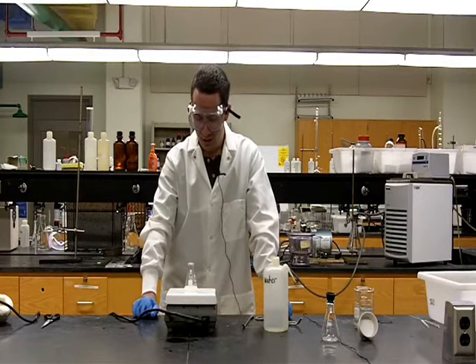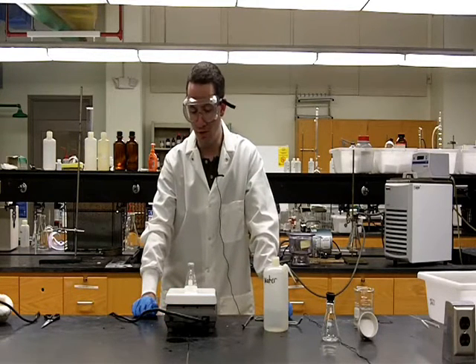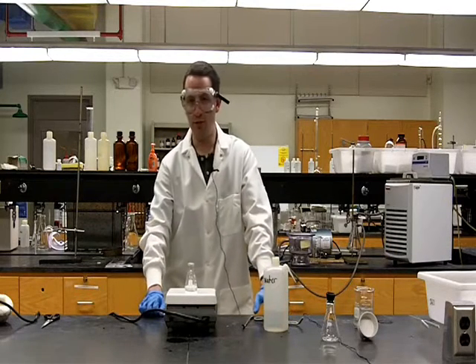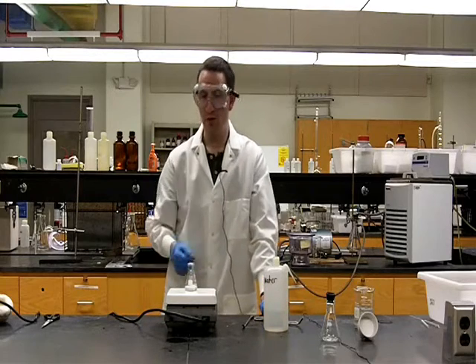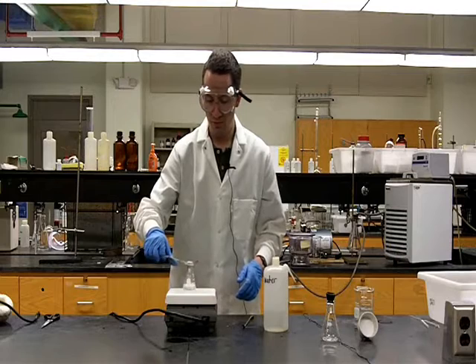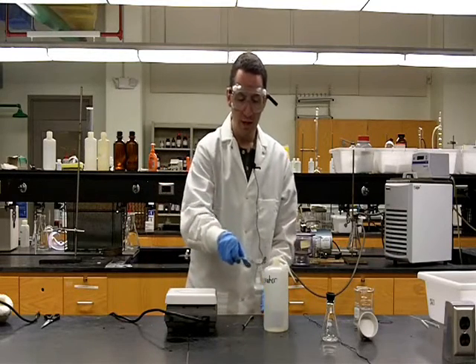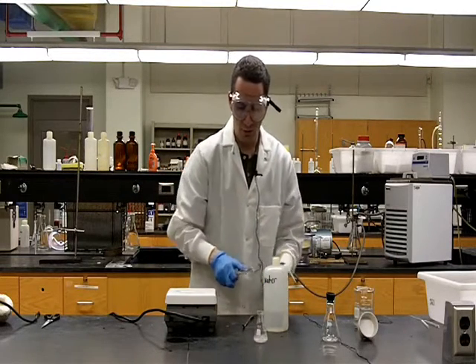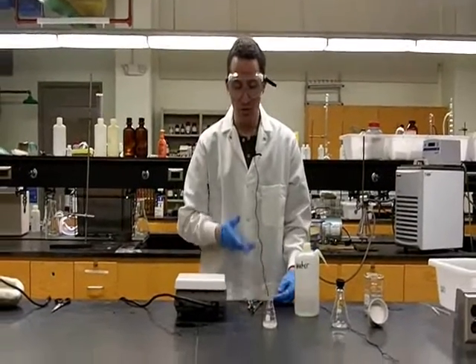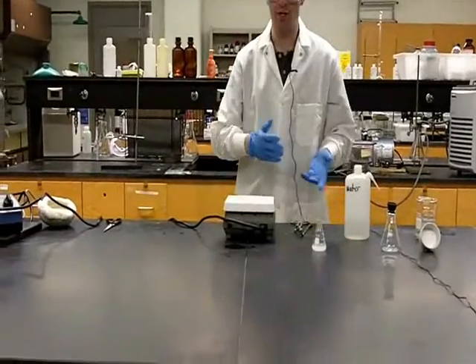So we're going to continue to add small amounts of water and bringing our solution to a boil. Now after the last addition we were very, very close to everything being dissolved, so it should not take much more. And as we can see with this additional amount of water, everything is dissolved. So we're now going to remove this from the hot plate and let it cool, and we are going to zoom in on that. And as it cools, we should see the solid coming back out of solution and crystallizing.